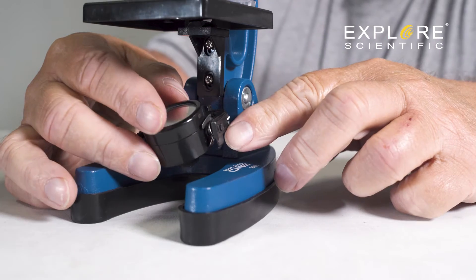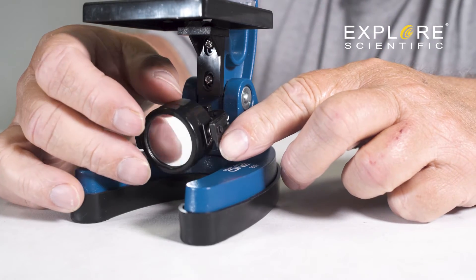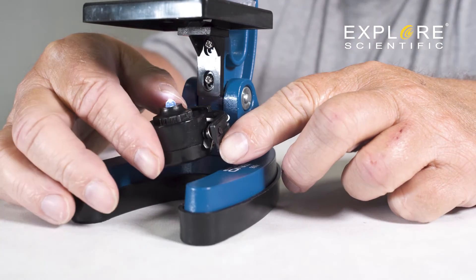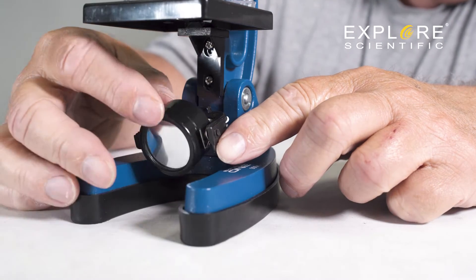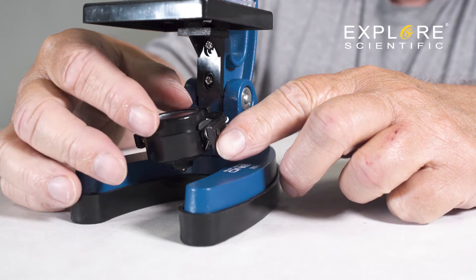Below the stage is the LED light and ambient mirror. This can be positioned either way depending on your available light. Please note that the light will not turn off unless it is turned upside down with the ambient mirror facing up.